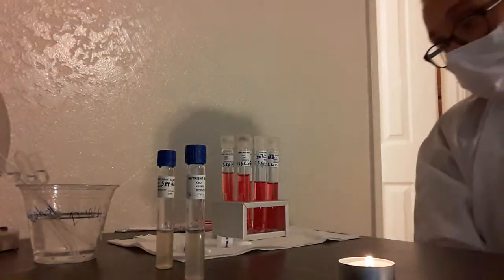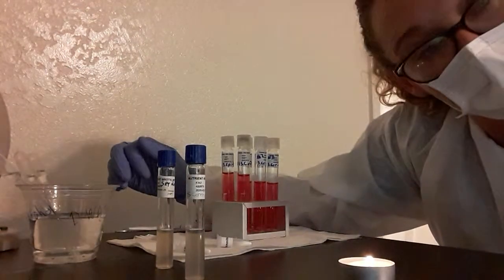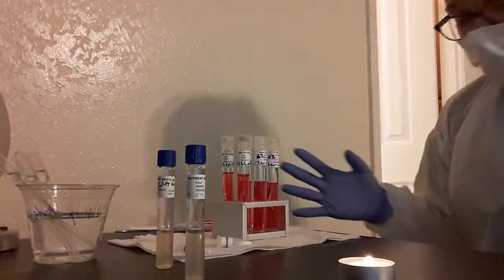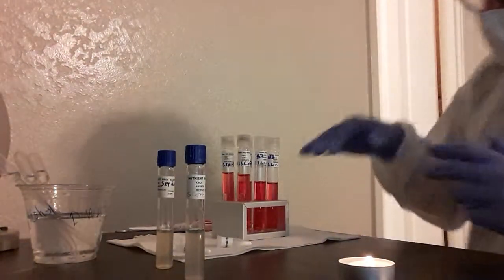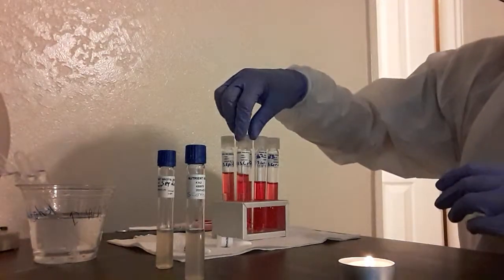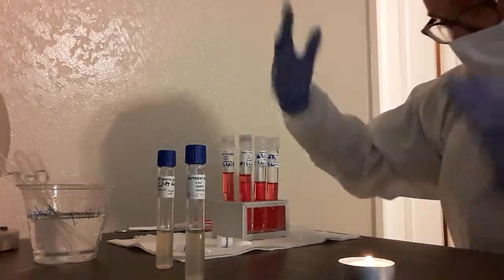Basically, I've already done the glucose just to get a test run at it. And I've already soaked my Durham tubes in alcohol because they take a little bit to dry. It also takes a little bit to get the alcohol out of them, surprisingly. So I'm going to walk you through the steps I took for the glucose and for the fructose. I labeled them: I have my 1 and 1, 2 and 2, and 3 and 3.